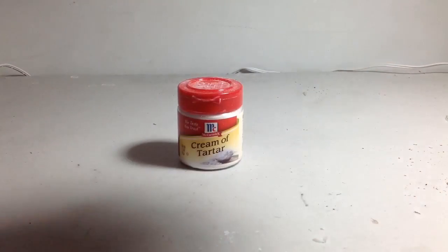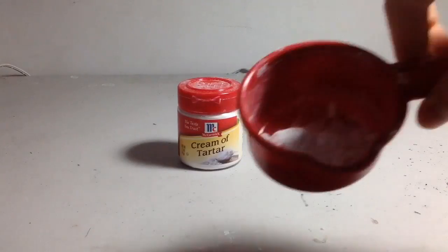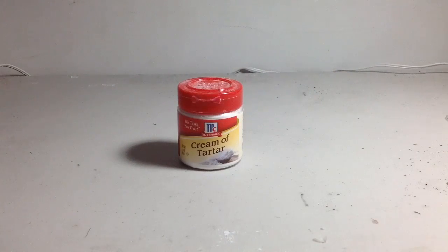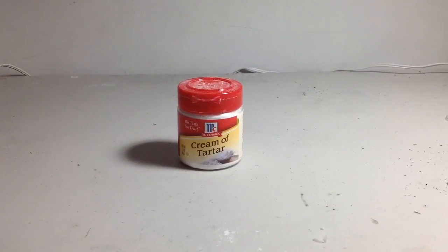Rochelle salt is potassium sodium tartrate, and so what we're going to use is cream of tartar, some sodium carbonate, which I made in my last video by heating baking soda. You'll need some of that.